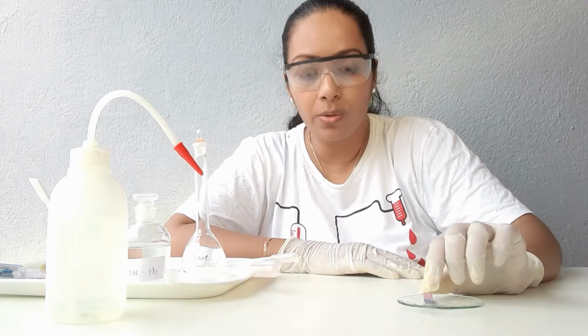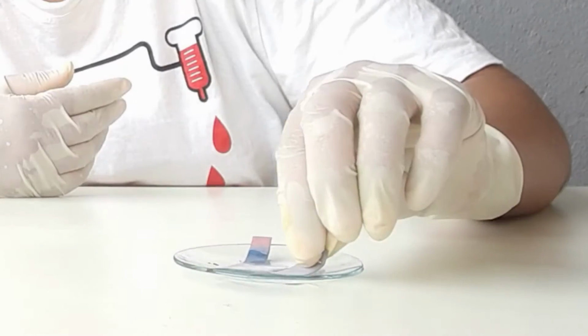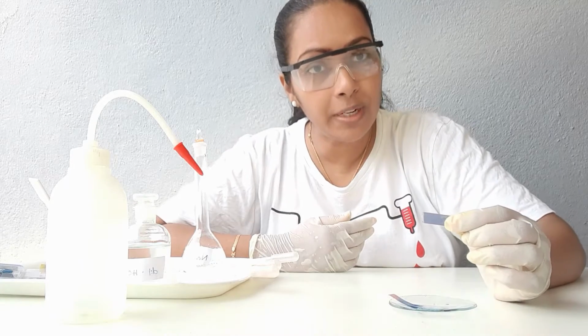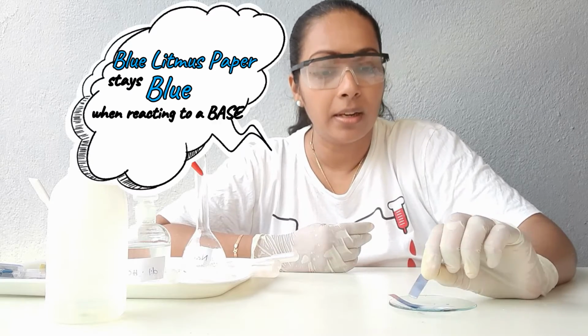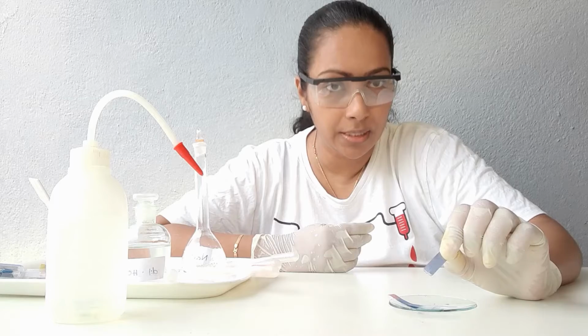Now let me try out a blue litmus paper. Will the blue litmus paper change its color with bases? No, it will remain the same. So with bases, red litmus turns into blue, but blue litmus does not change.